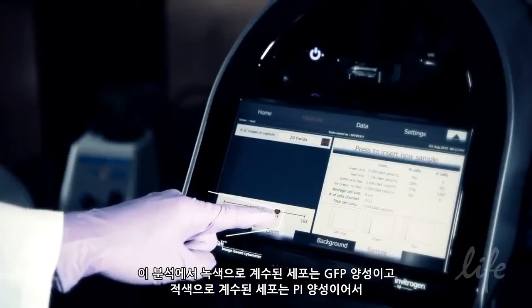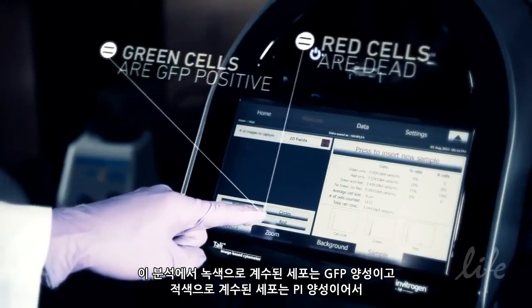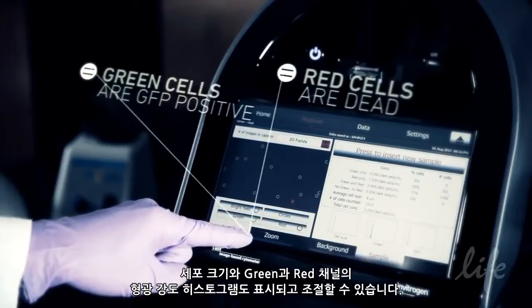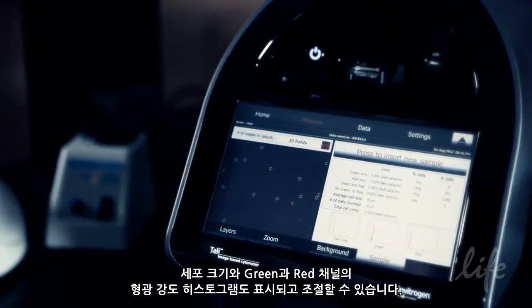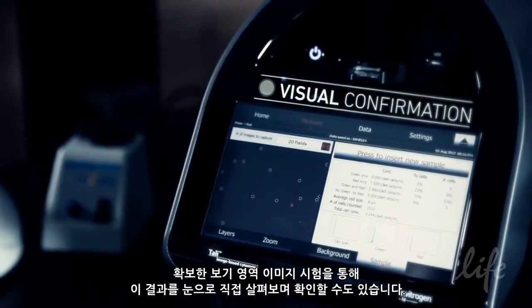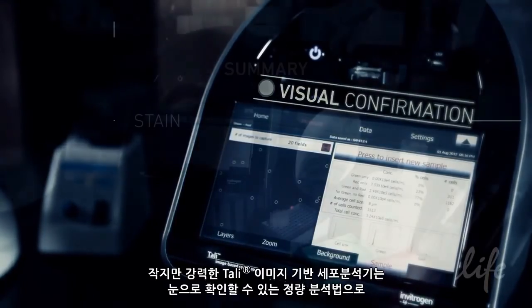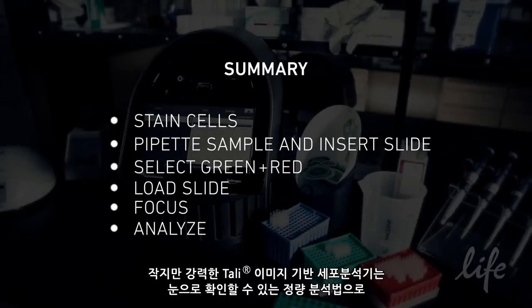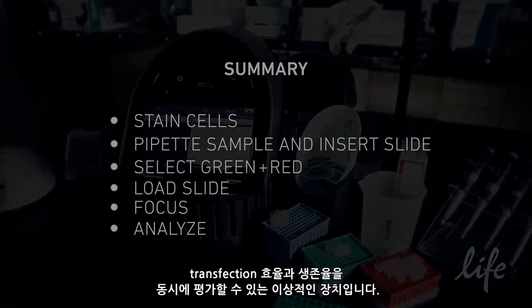In this assay, cells counted green are GFP positive, and cells counted red are PI positive and can be considered dead or dying. The histograms for cell size and fluorescence intensity for green and red channels are also displayed and can be adjusted. The results can also be visually confirmed by examining the images of the captured fields of view. The small yet powerful Tali image-based cytometer offers quantitative analysis with visual confirmation, making it ideal to simultaneously assess transfection efficiency and viability.